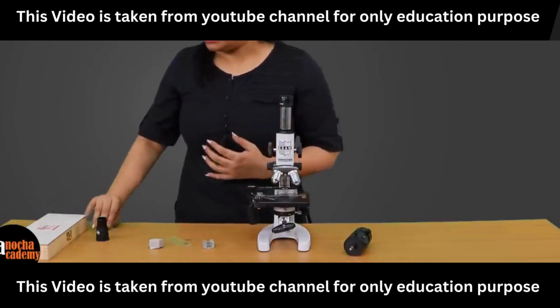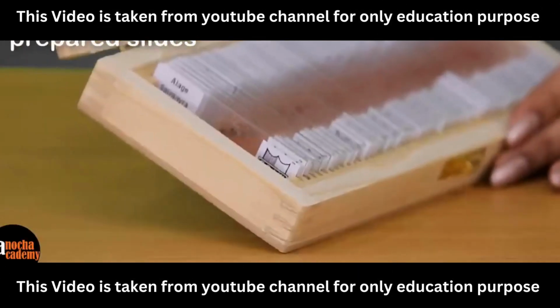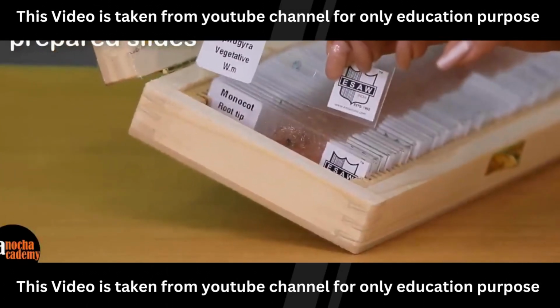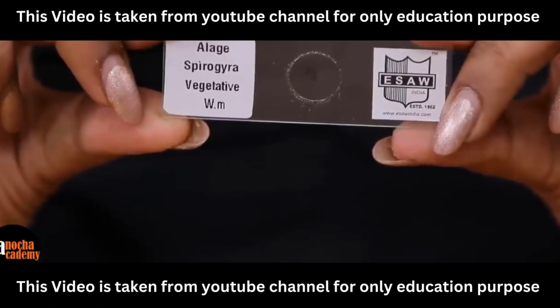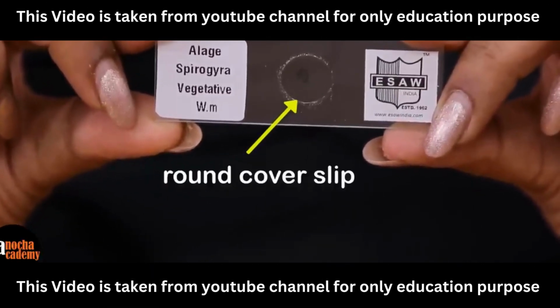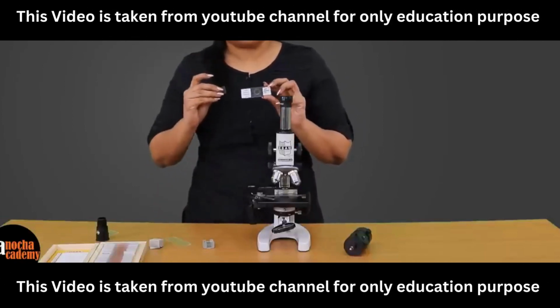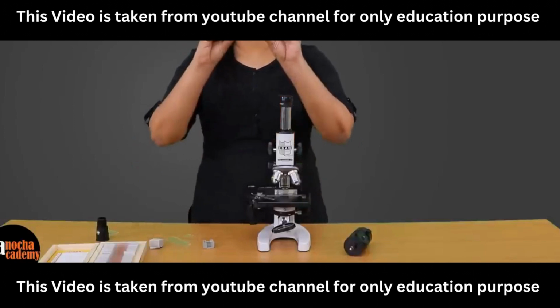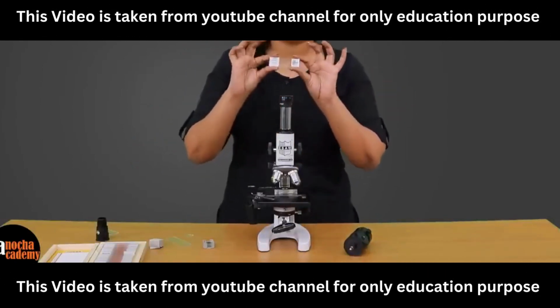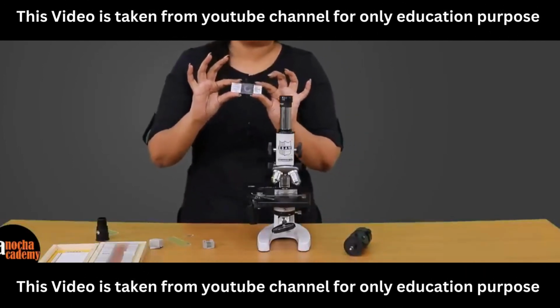Now once you have prepared your slide, sometimes we have prepared slides. For example, we have a large number of prepared slides here. I will show you one of them. This slide is of the algae Spirogyra. As you can see, there is a cover slip here. In this case, the cover slip is round, but you may also have square cover slips like this, right? This is a permanent slide which has already been prepared, and this will stay for a very long time. It will not get damaged because it has been preserved that way.